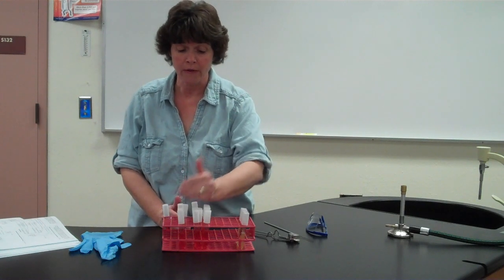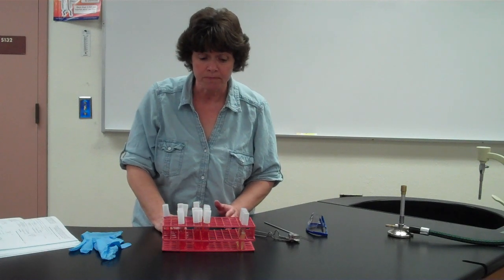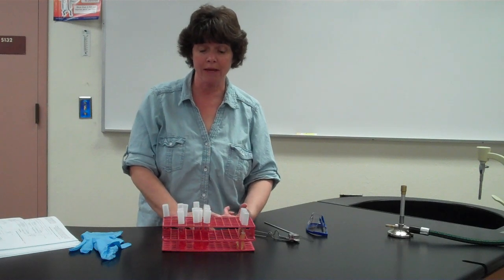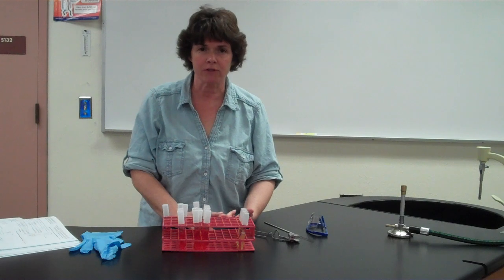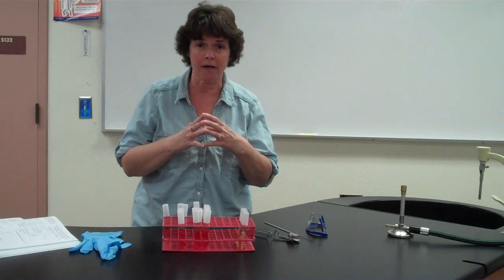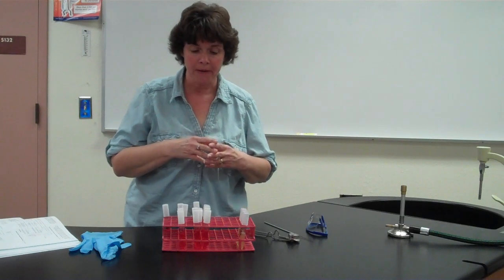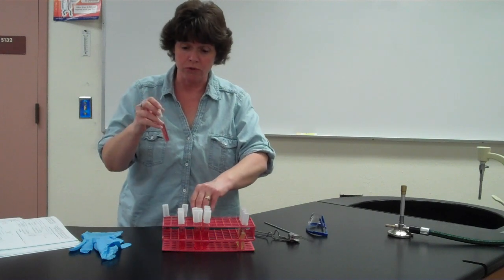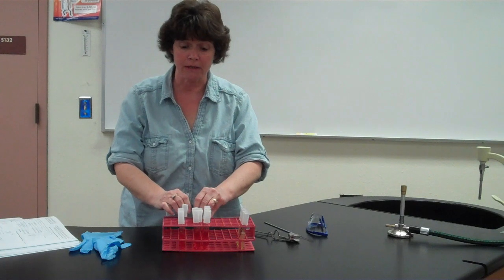So share the work. Now, the first thing you want to do, obviously, is label your tubes. Make sure that you label them not with just the bacteria's name, but also your group name, group number, something to identify yourself. Because what usually happens is we condense everything in the incubator and things start to get mixed up, okay? So we have our 15 tubes, we have them labeled. Label the controls, C or something like that for control, because you're not putting bacteria in there.